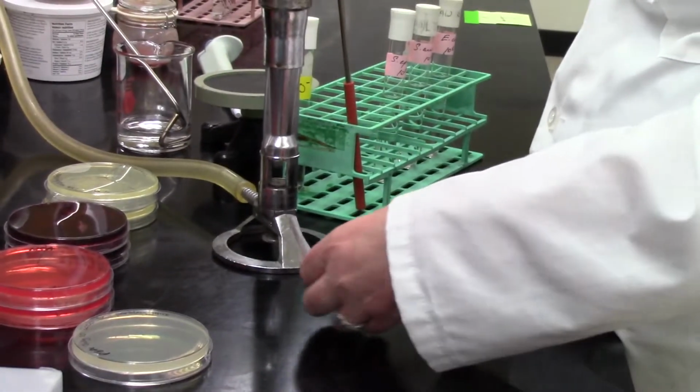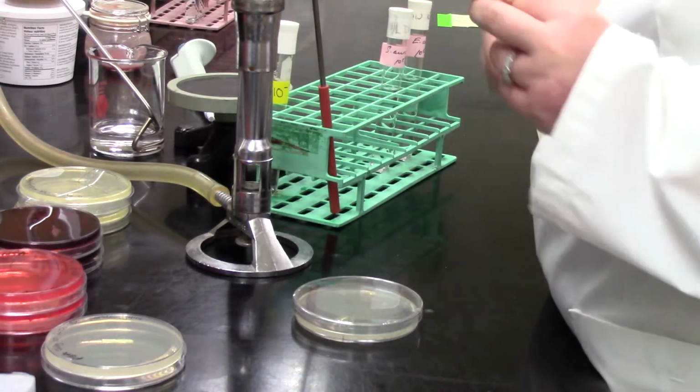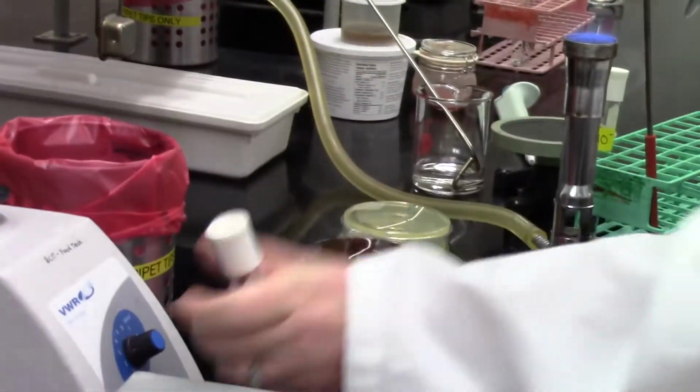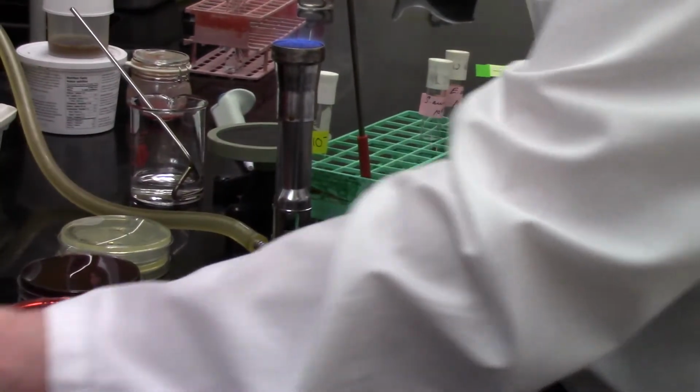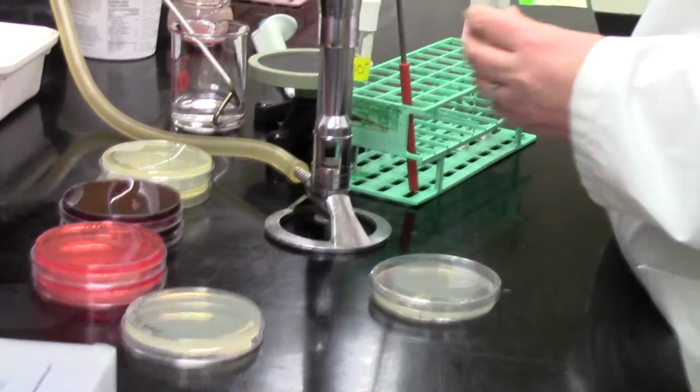So she's just going to, and you'll see her do it, just do a squiggle inoculation of these plates, where she's simply going to draw a little squiggly line back and forth to inoculate that plate, and she's divided it up into 3 sections so she can put all 3 of our known bacteria on that plate.